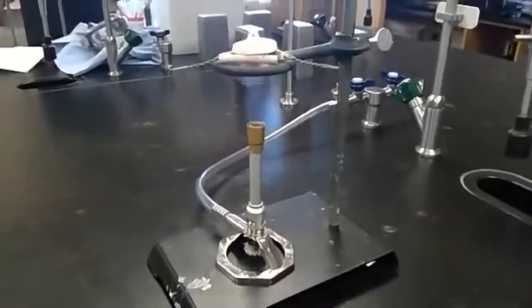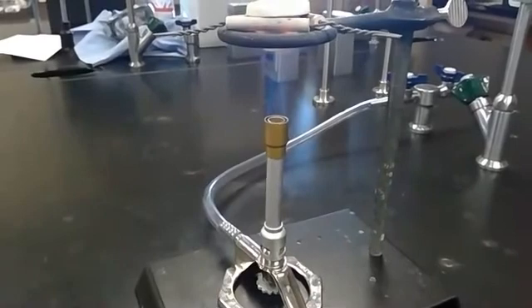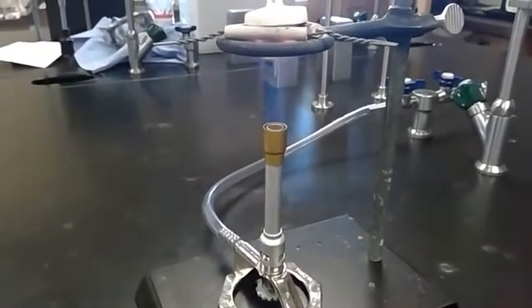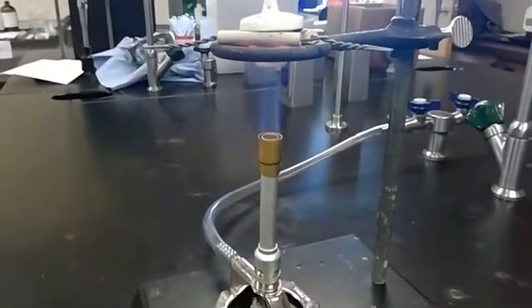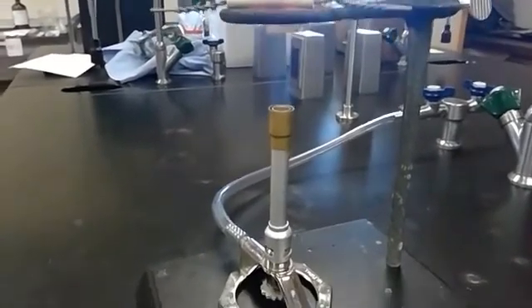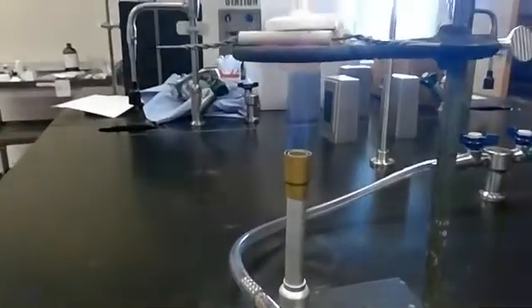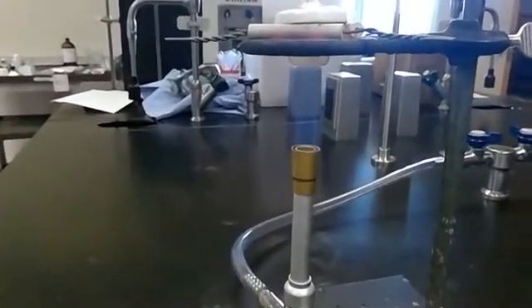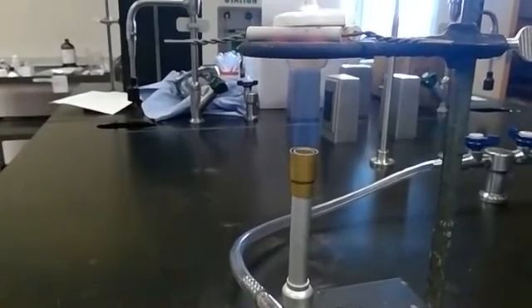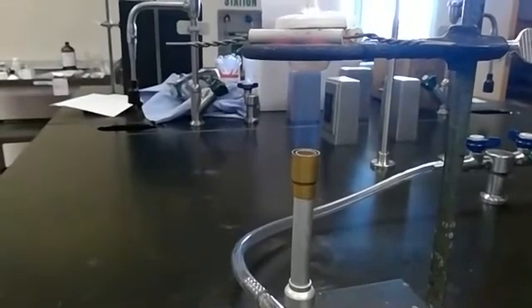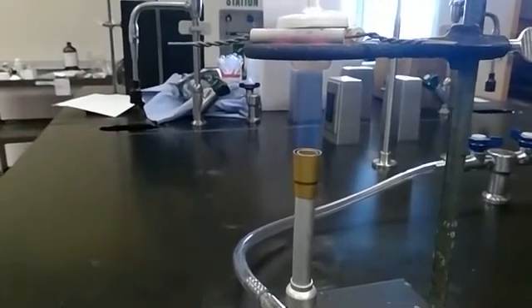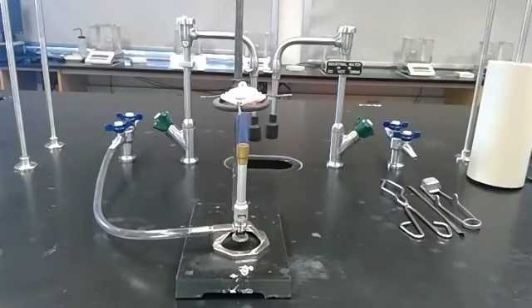Here's my setup again—you can see that inner cone of blue inside my flame is just touching the bottom of the crucible, almost creating a little blue shelf of fire. This is heating up the crucible, and you can see it's starting to get red hot. That's what we're hoping for. We're going to heat this so our ceramic crucible is red hot. It has been five minutes since we've heated to the point where the crucible is red hot.